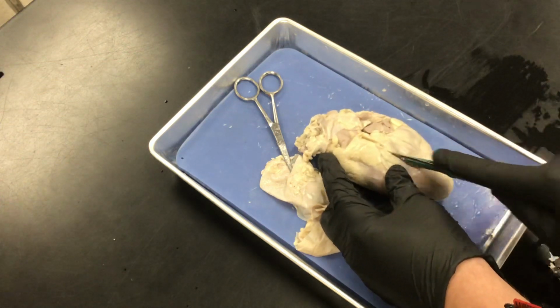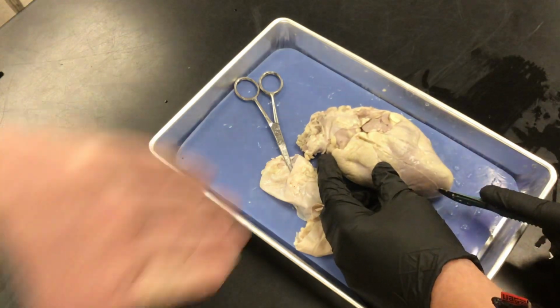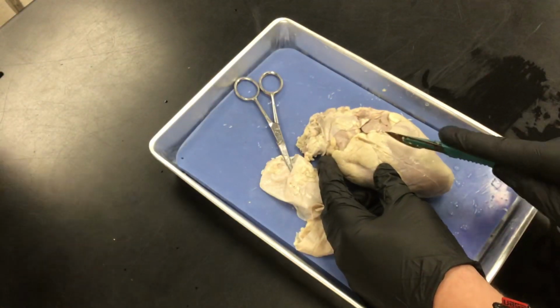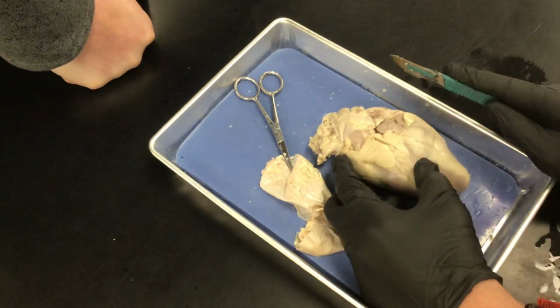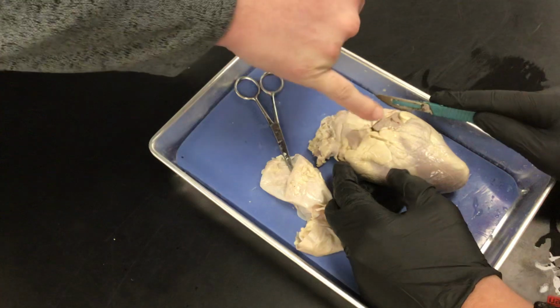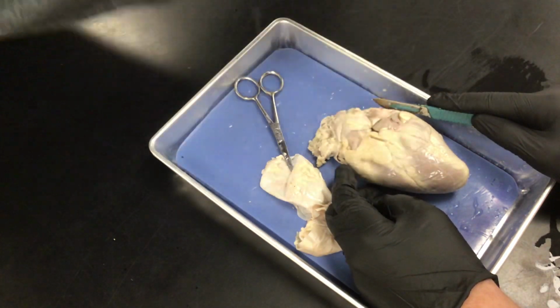So what's the purpose? That's why we have to put a stent in there, right? What would happen if that artery filled up with, you remember we talked about draining the bacon grease? What would happen if that filled up? Where is that coronary artery taking blood to? It's an artery, so it has oxygenated blood, but where's it taking it to?